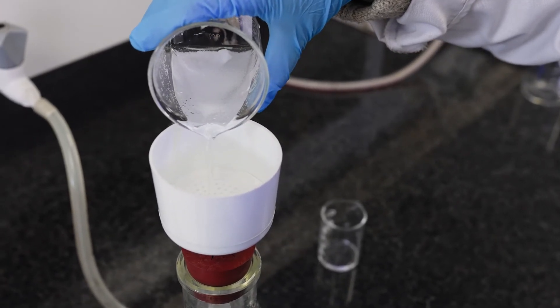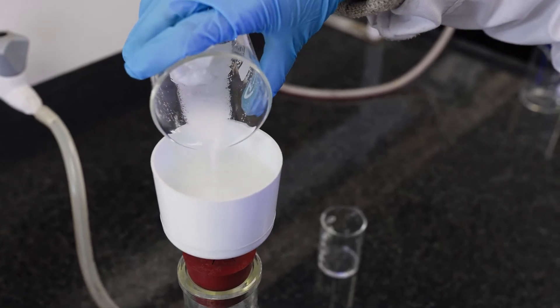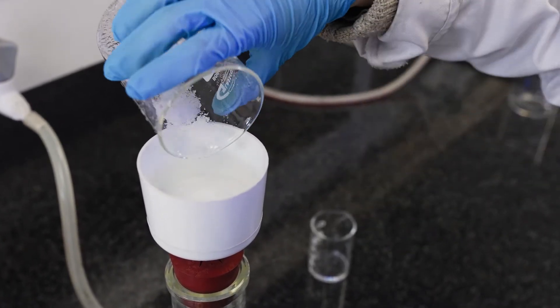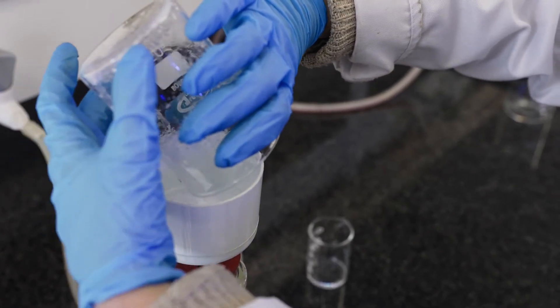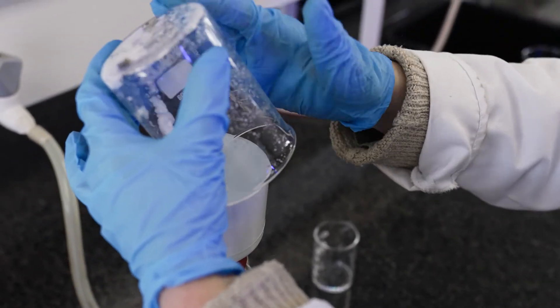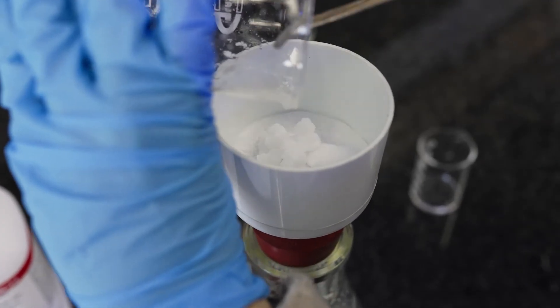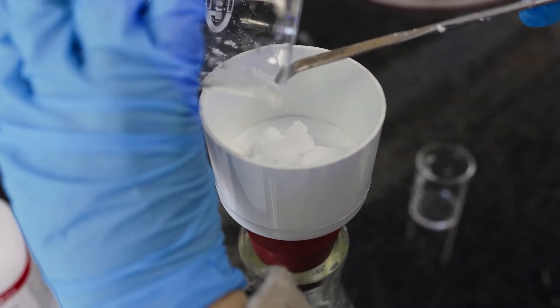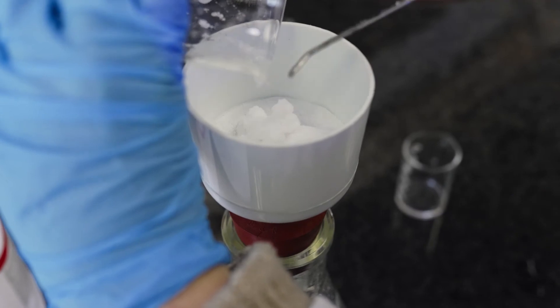Remember that it's important to make sure all of your ice is dissolved before adding it to your Buchner funnel — not because it will block the solution, but because any ice left is later going to add to your crystal weight. It's important to get as many crystals out as you possibly can because this is going to affect your percentage yield.